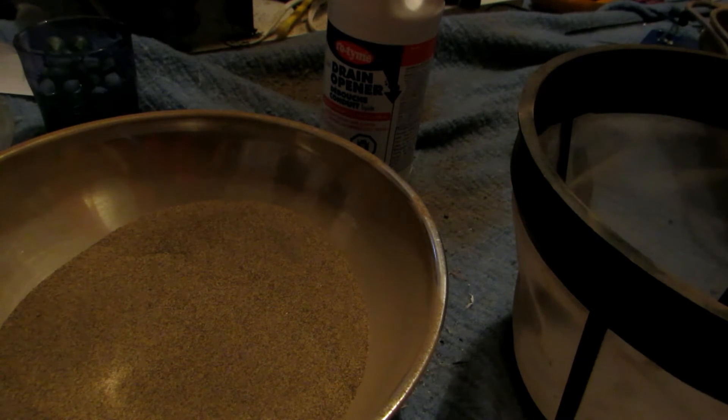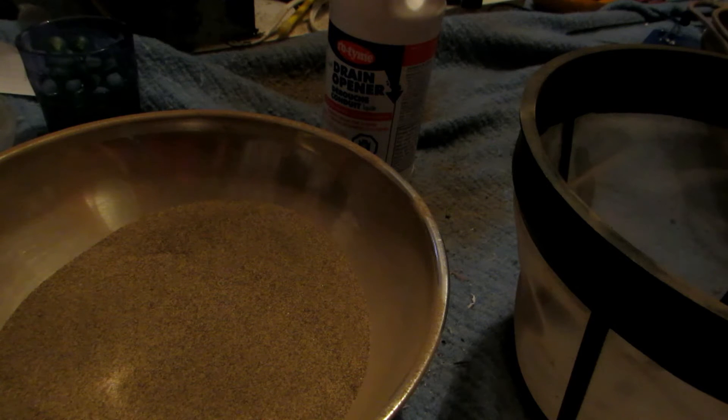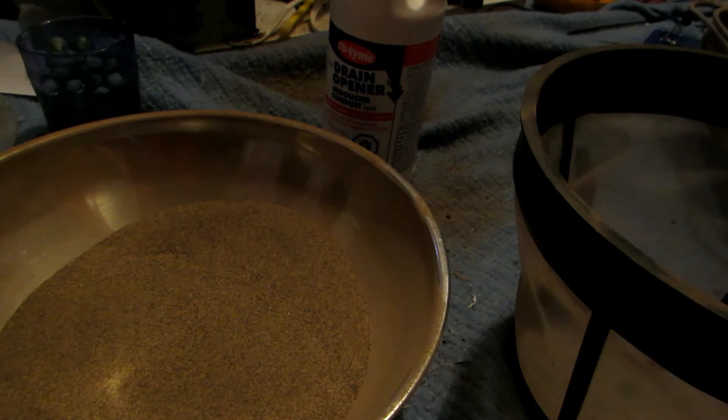You need a distillation apparatus, which you can buy online on eBay for about $30 — pretty cheap. You could use a heating mantle, but they're rather expensive. Oil baths won't work either because sulfuric acid boils too high; the oil bath will actually start vaporizing before we reach the boiling point of sulfuric acid, so we have to use something else.